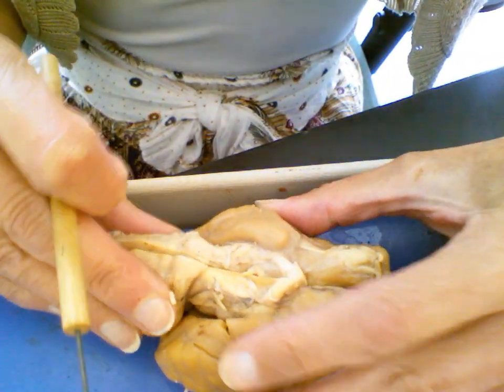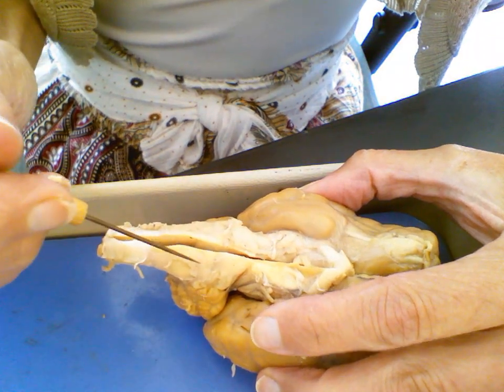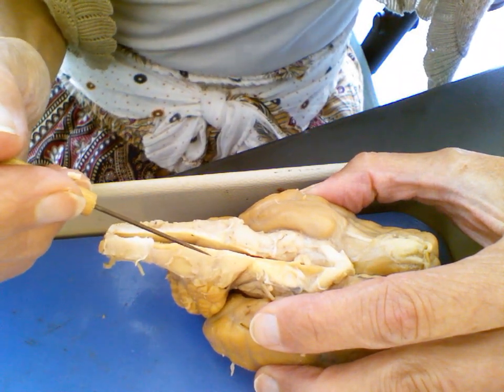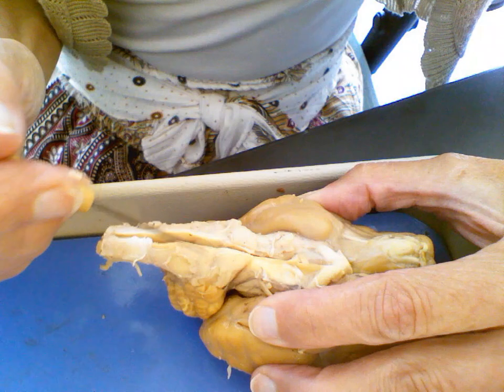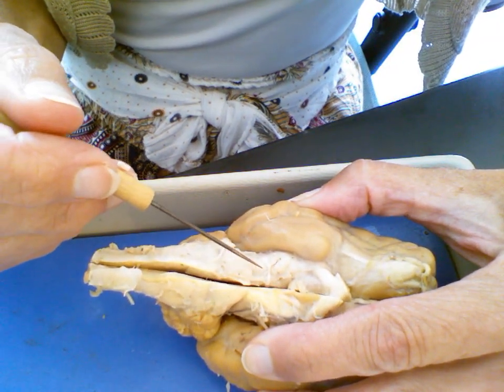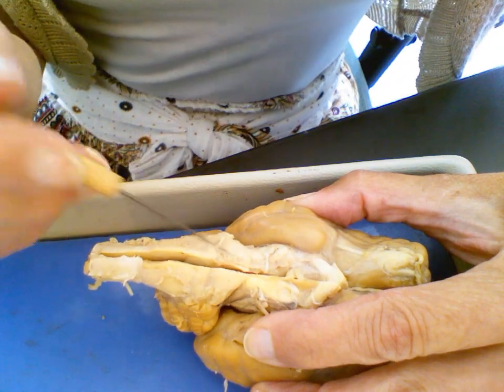We can also see clearly on this side the brain stem. And the brain stem consists of three parts. This lower part that starts where the spinal cord is and moves up to about here, it's a long section called the medulla oblongata. So medulla oblongata. And here we see the pons. Okay, so right here. And then just anterior to the pons, we run into an area that we know of as called the midbrain, which is easier to actually locate within the brain when we do a cut.